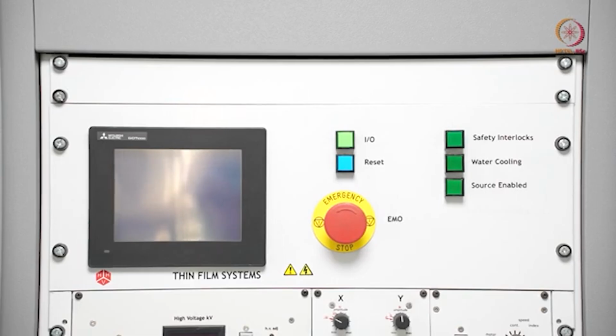Like that, as we have shown one door here, the front door, we have opened and showed you the things. So we have 3 doors to access the different areas. All these 3 doors are connected to the same safety interlock, and the vacuum created in the chamber is also connected to the safety interlock. We should ensure that at least some amount of vacuum is there before starting the process.